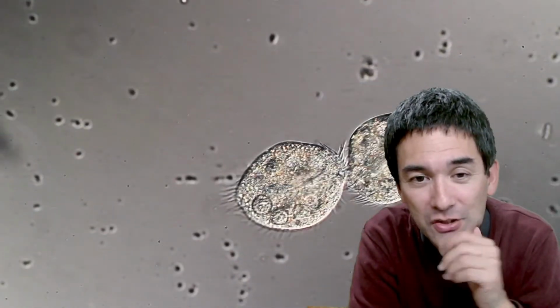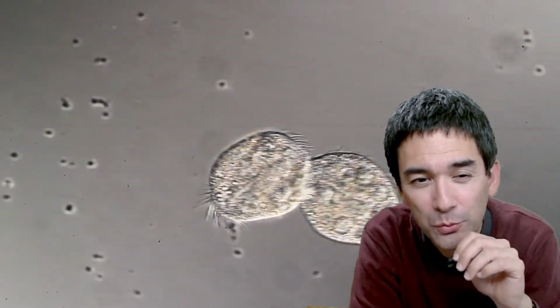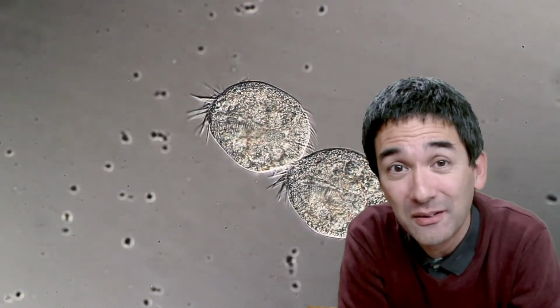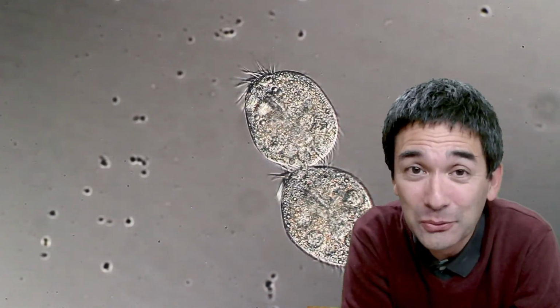I just wanted to show you this because this concept of mitosis, of chromosomes moving, is happening in all eukaryotes. Eukaryotes are those cells that have a nucleus, and in contrast you have the prokaryotes. The bacteria belong to the prokaryotes, and they have a much simpler way of dividing.